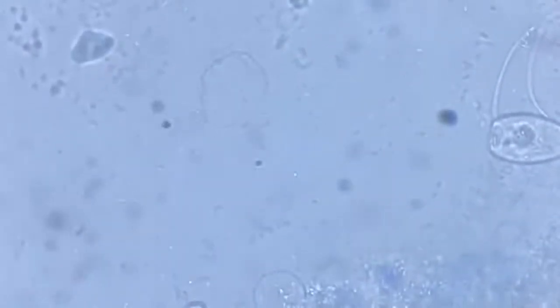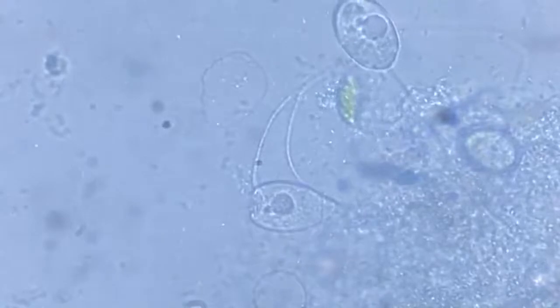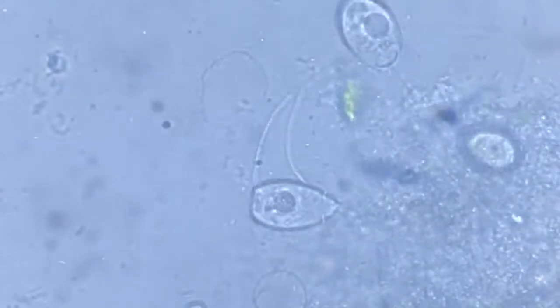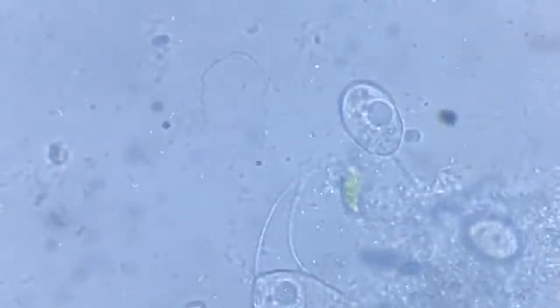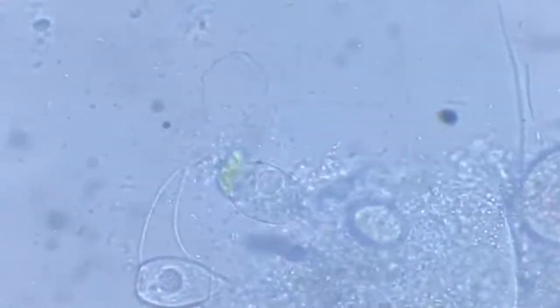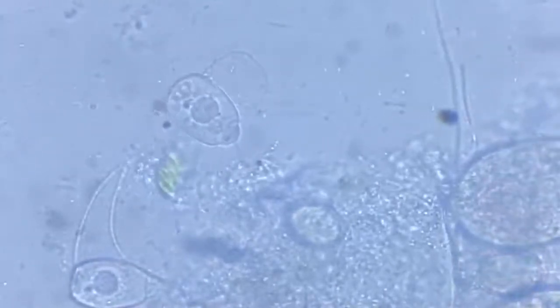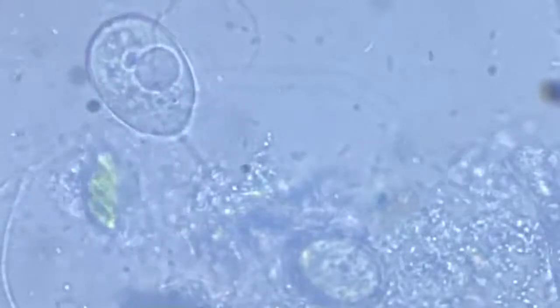All right, something else. Let's try and find something more. What about this fellow? He looks okay. He looks different. We'll focus on him now. Observe him for a while.